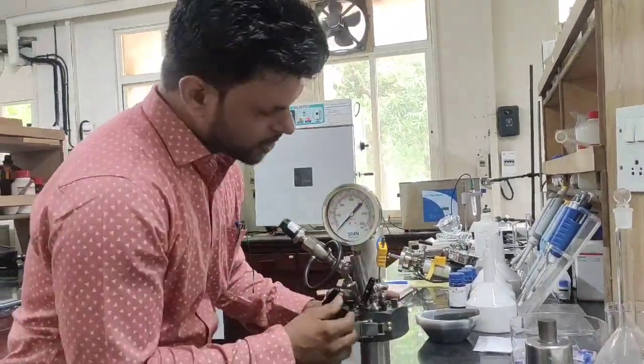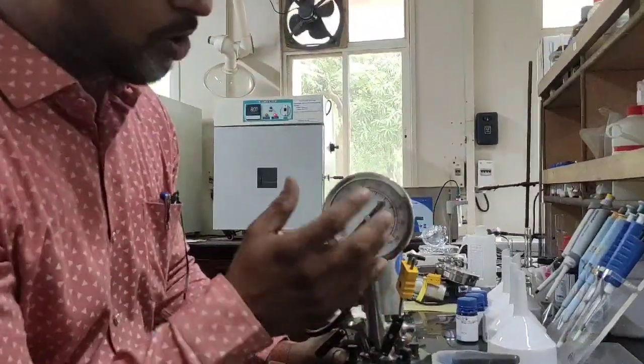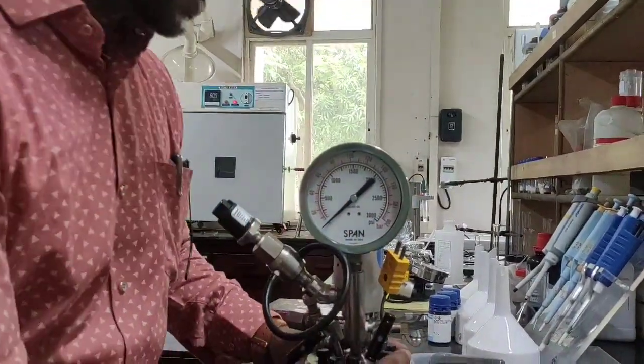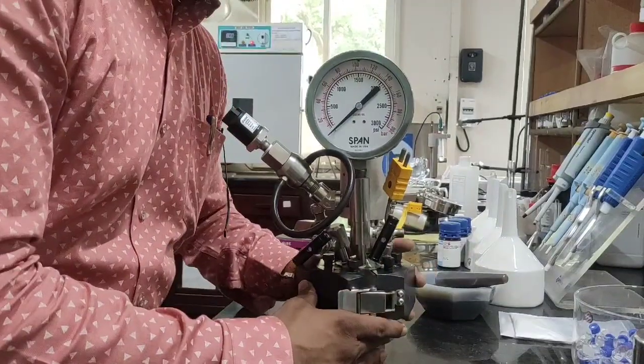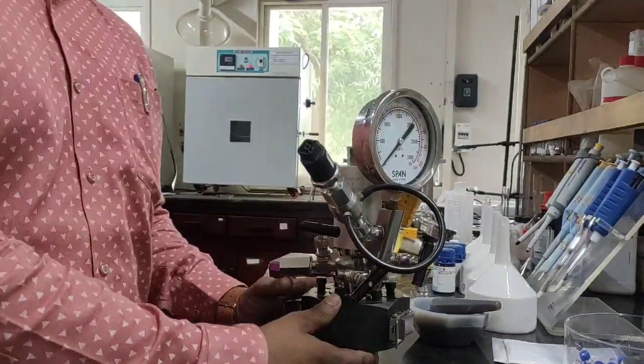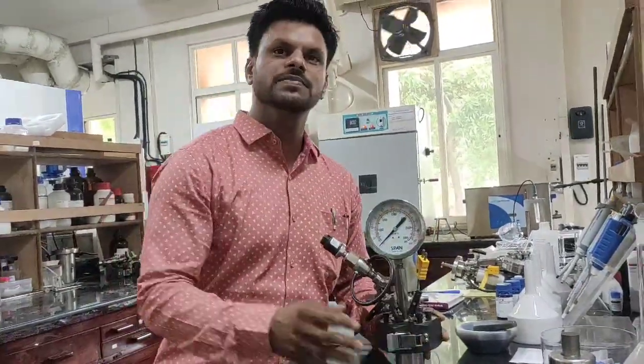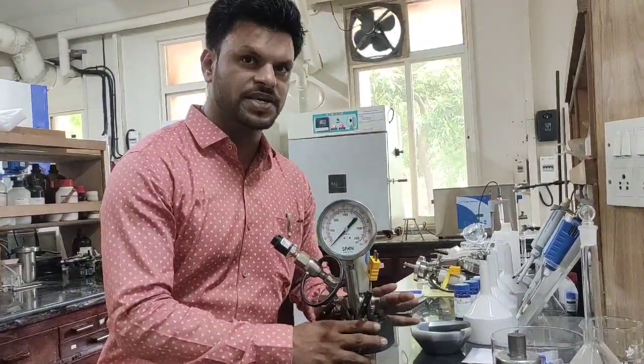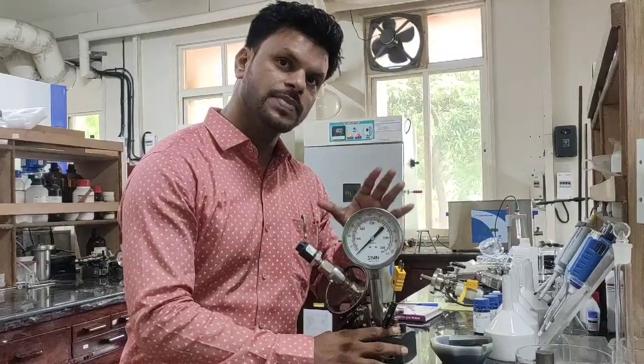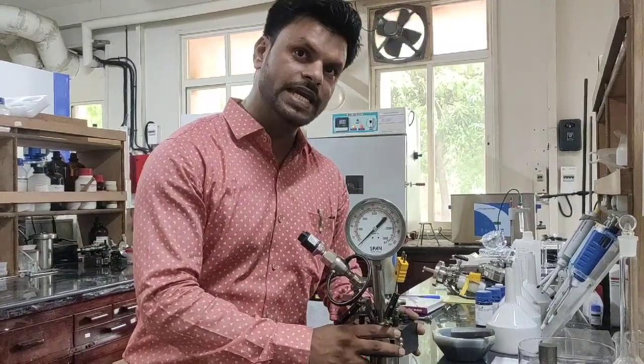And with this here on the screen you can watch what is the pressure the system is now currently working on. And later we have to start the reaction and the whole thing has to be closed and this is simply a closed batch reactor. Be sure that there is no leakage.